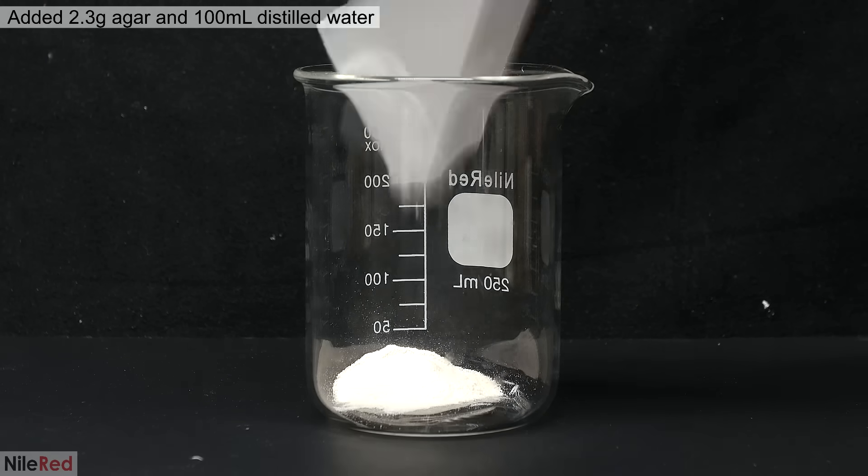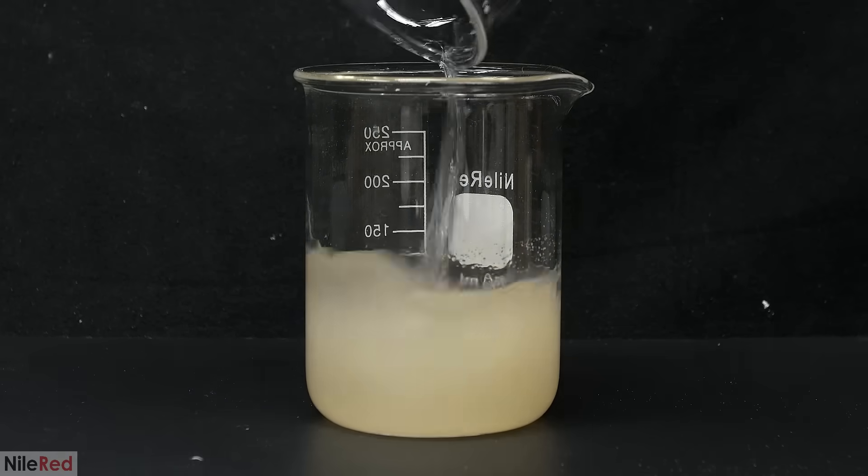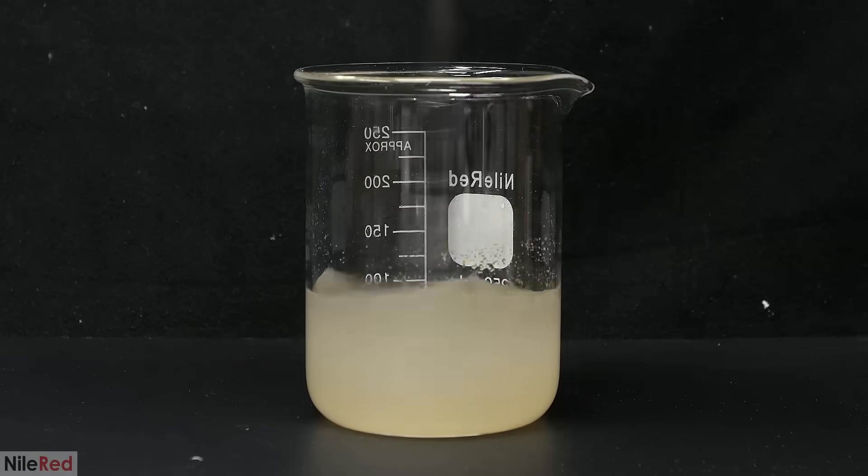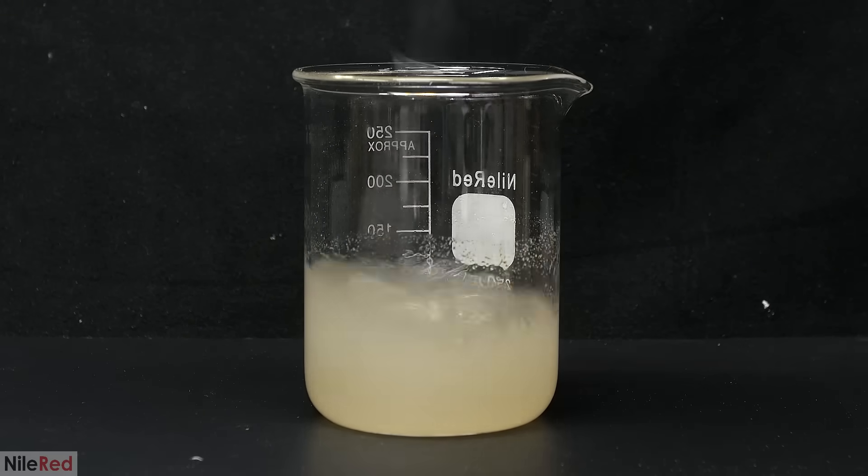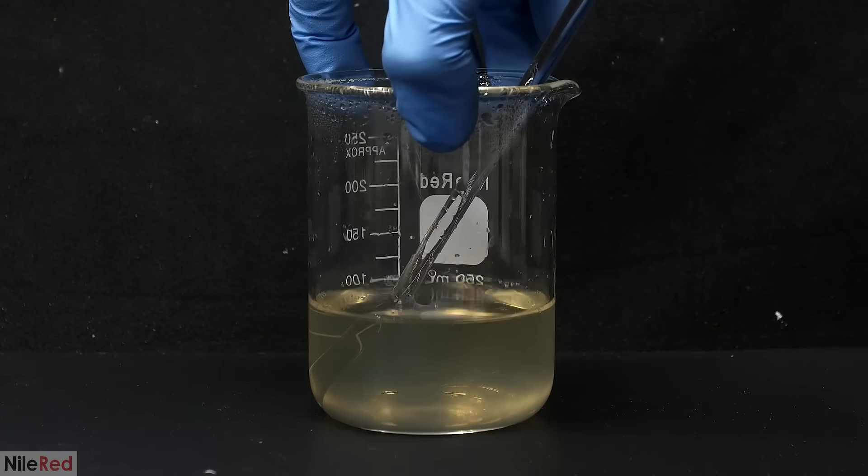Into a beaker, I dumped in 2.3 grams of the agar, followed by about 100 milliliters of water. At room temperature, it's not really going to dissolve, and it needs to be heated, either using a hot plate or a microwave. In either case, it's heated to its boiling point, and then it's boiled continuously for another minute.